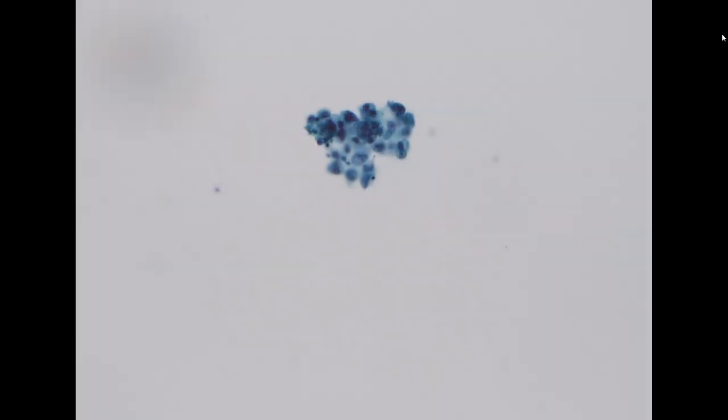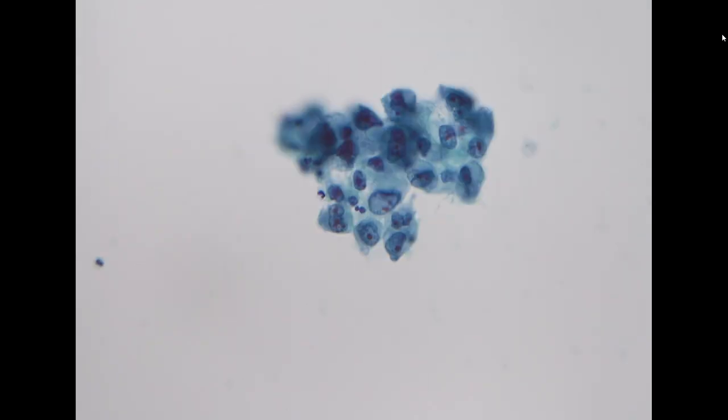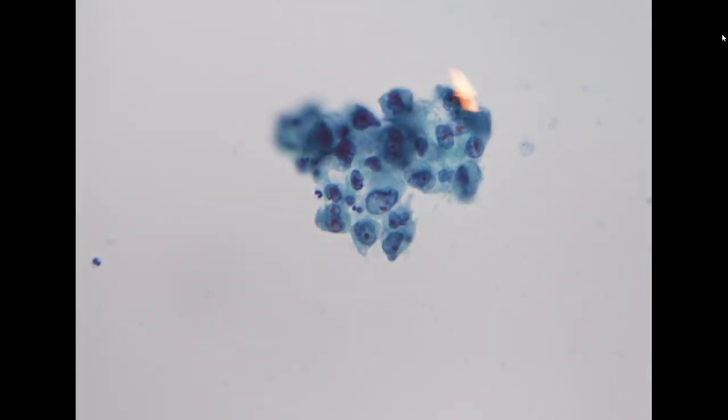So the next specimen is a pleural effusion specimen as well, but the patient has a very unusual history. This is a cytospin preparation. As you can see, there's a ring of cellular fragments at the periphery, which is due to the cytospin preparation. This is an artifact. And here we definitely see some malignant cells in clusters. They are somewhat epithelioid, so if you guess this is carcinoma, that is quite reasonable.